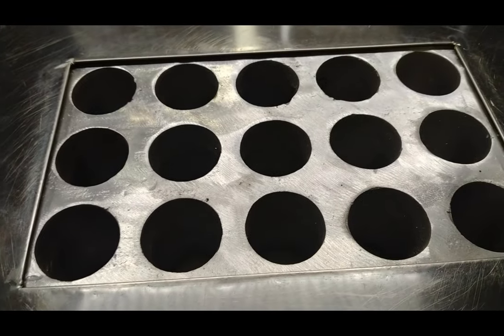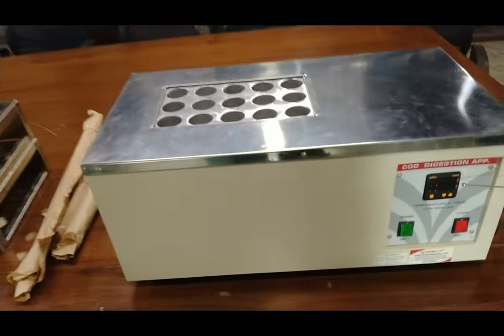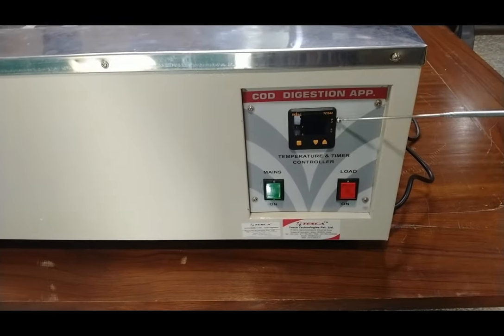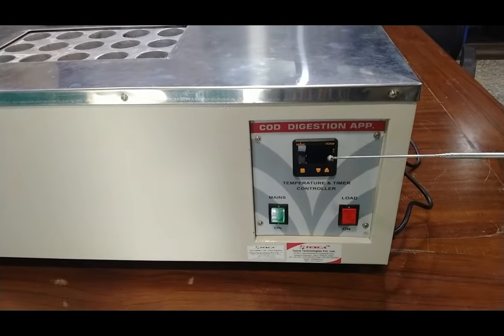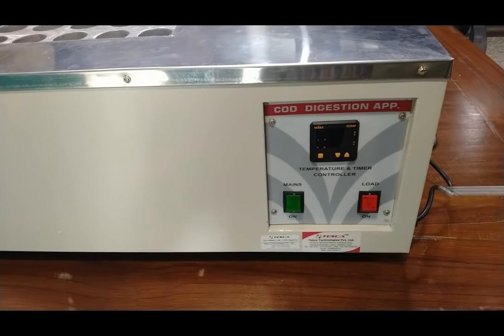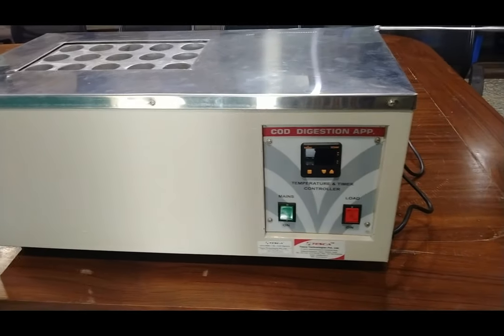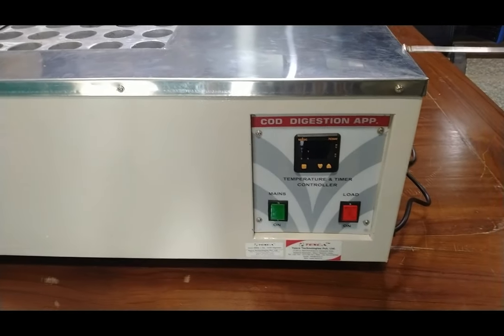Each hole is 40mm diameter. This is a digital PID temperature control display. It can take a temperature range up to 250 degrees Celsius. The timer goes up to two hours. Samples after being digested for two hours can be analyzed using a colorimeter or conventional titration method.